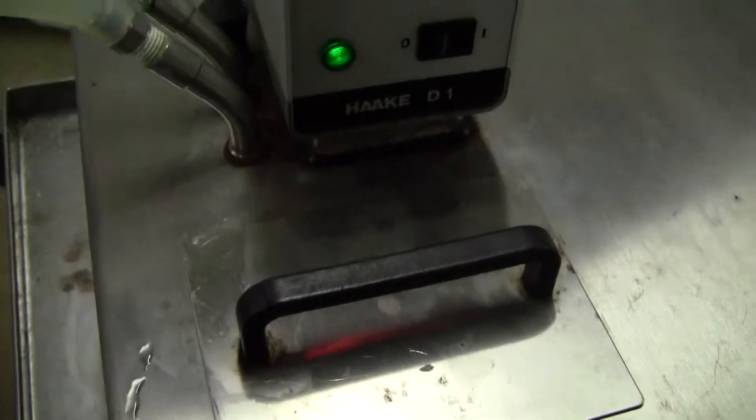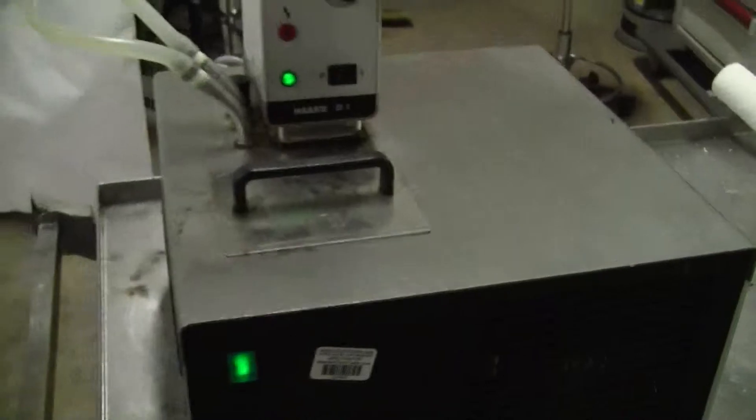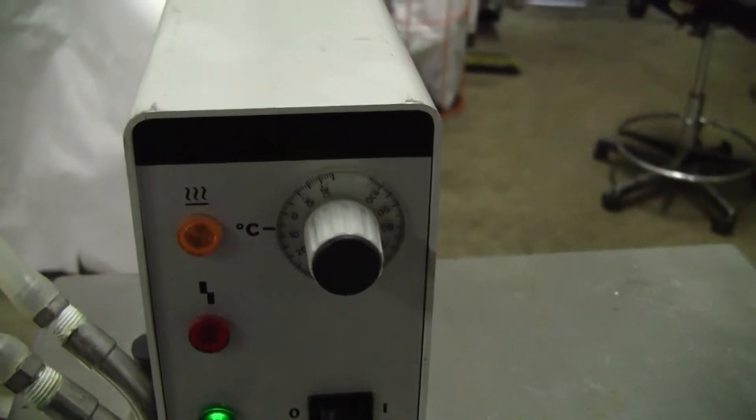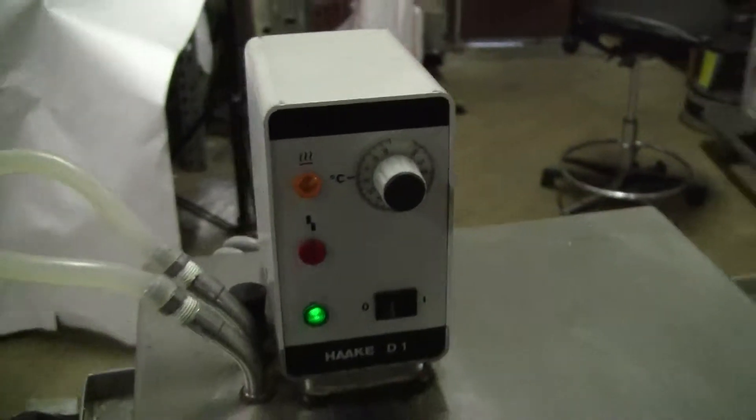Small volume application — I would even say it would go with about 4 liters. Controlling quite nicely. I actually have this running down to about 5 degrees. You can see it was oscillating there, just heating up.